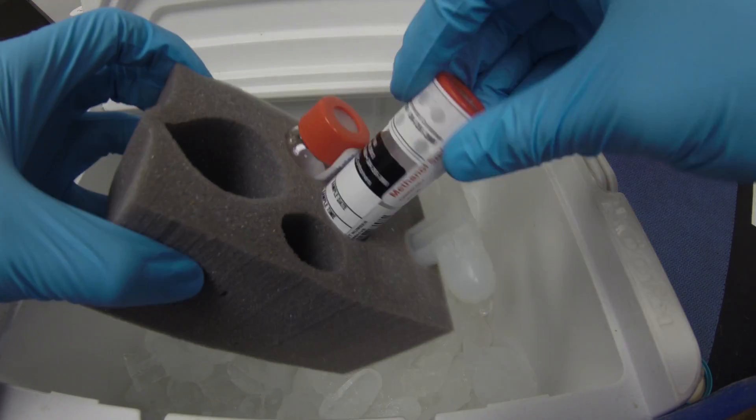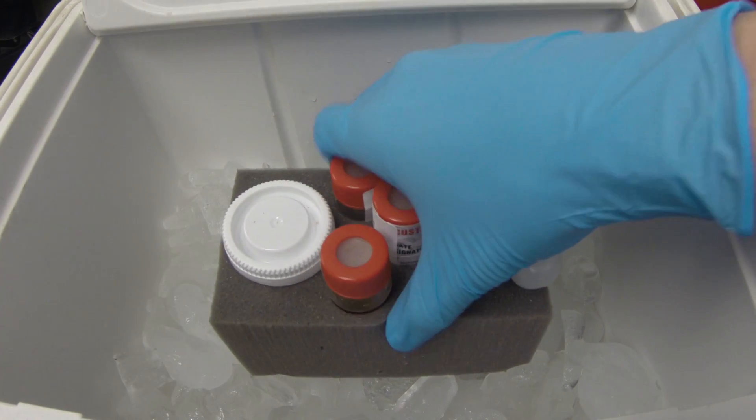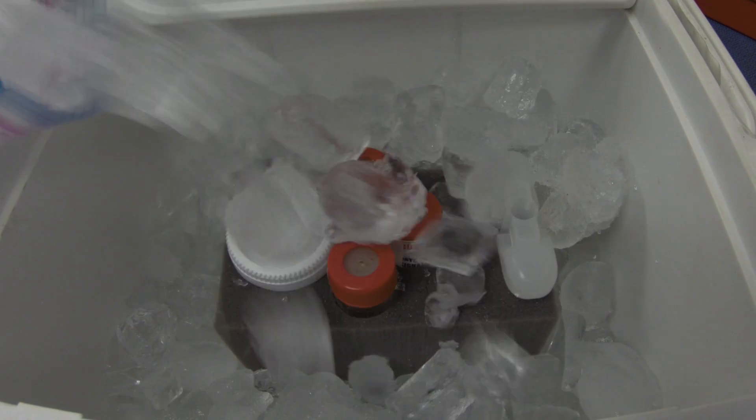Once your vials have been labeled, put them back into the foam container and then into a cooler with ice. Be sure that the ice is completely surrounding the foam container.